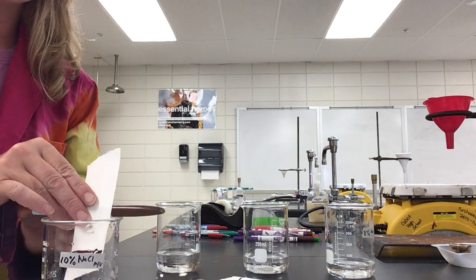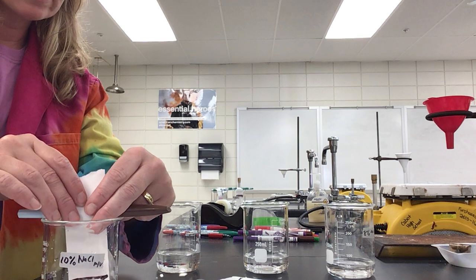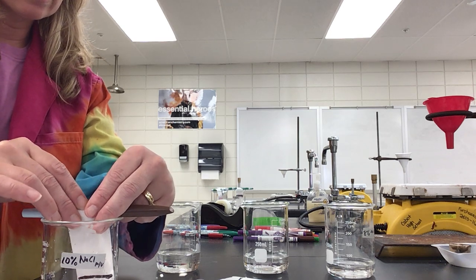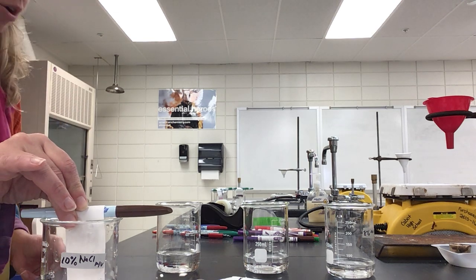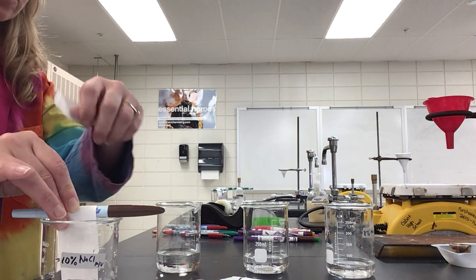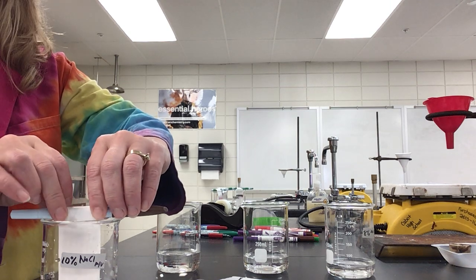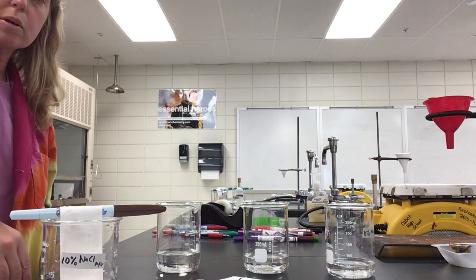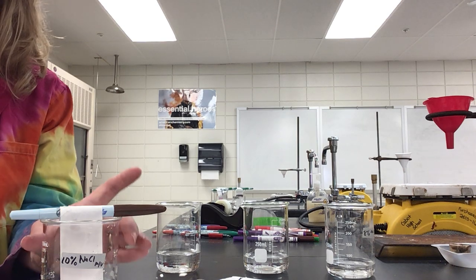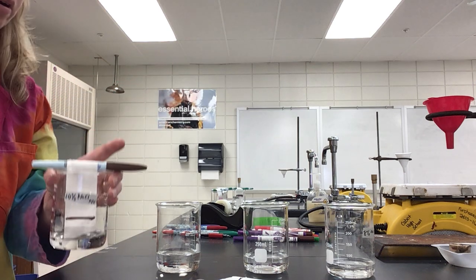So when you're taping this on, you want to make sure just the tip of your paper is touching, not the ink, because remember, these are water soluble. So if you stick the actual ink mark in there, it's actually going to bleed off the paper, and then it won't work, okay? So as you can see right there, here I'll hold it up and show you, that's how mine looks. And see how just the edge of it is touching the water, okay?